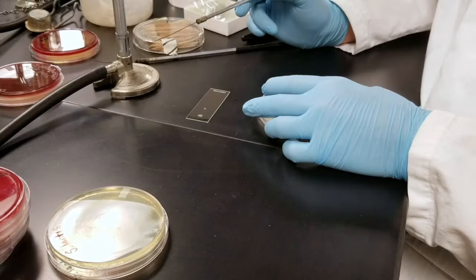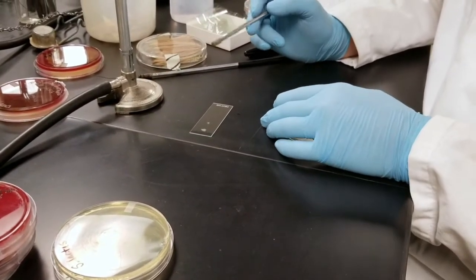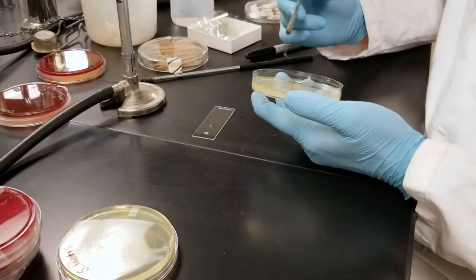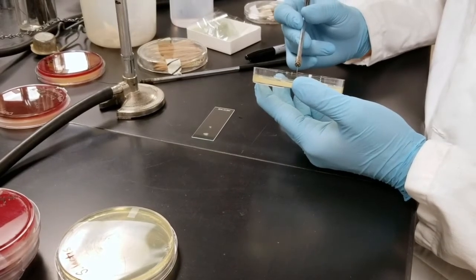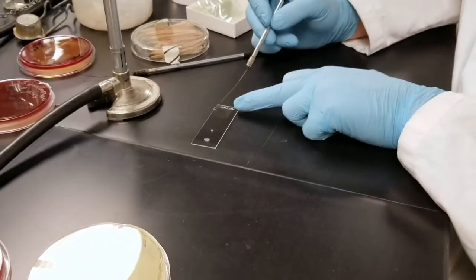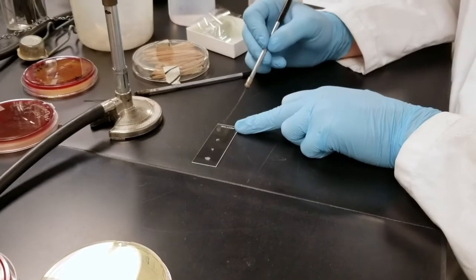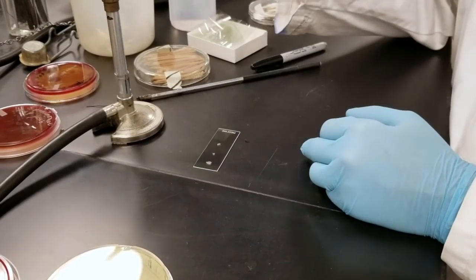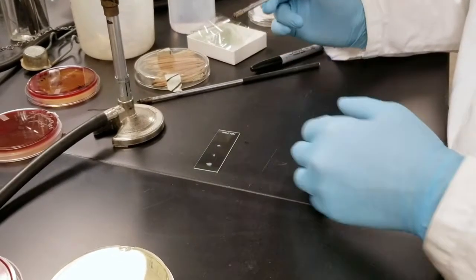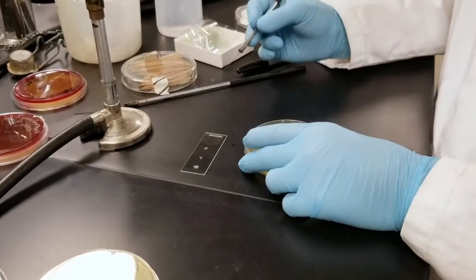What I'm currently doing is prepping a slide for a Catalase test. So I've already smeared 2 bacteria onto my sterile glass strip. If you have a petri dish, that would work as well. And what I'm doing is I'm collecting a small amount of bacteria from my plate and then just smearing it onto my glass strip. So remember, as always, to flame between each of these platings. That way you won't contaminate any of the cultures between your plate.